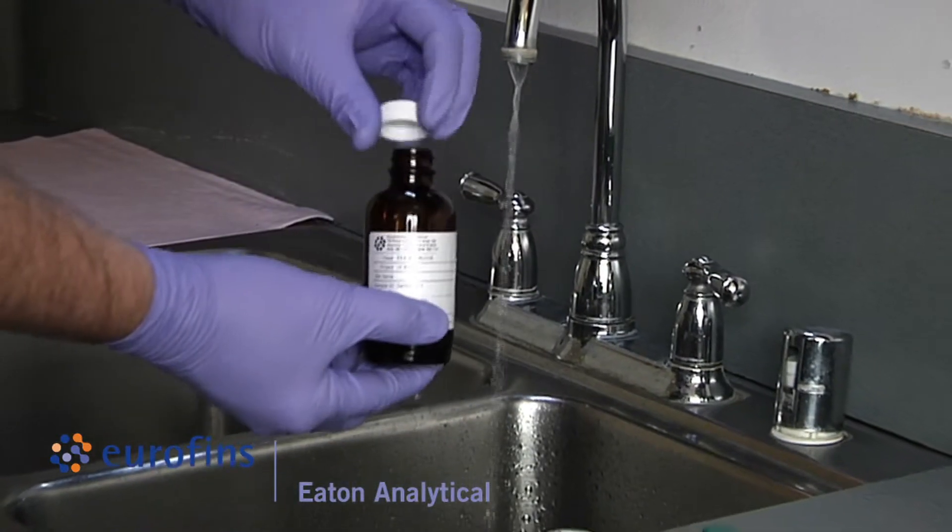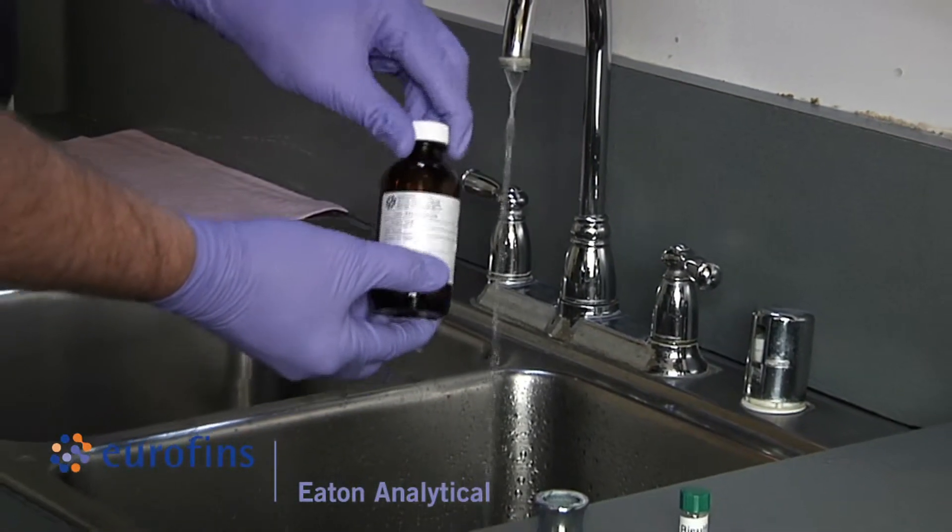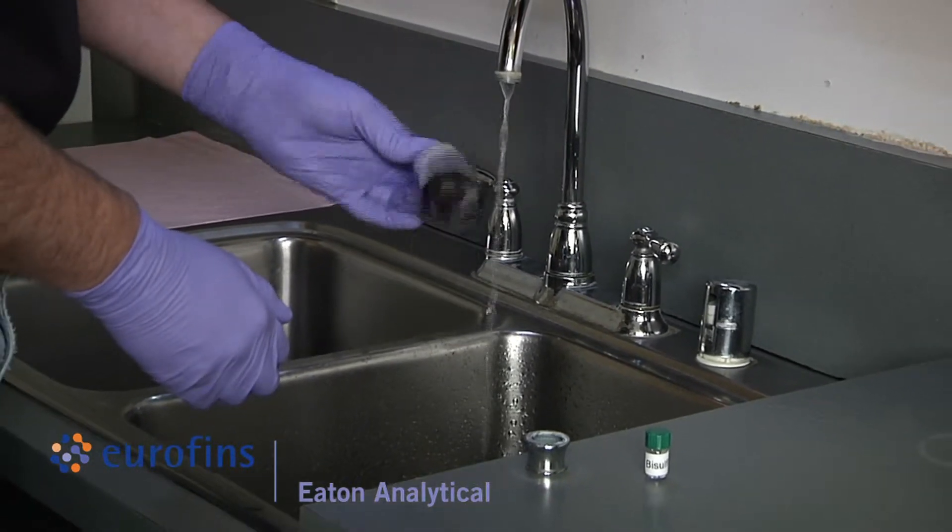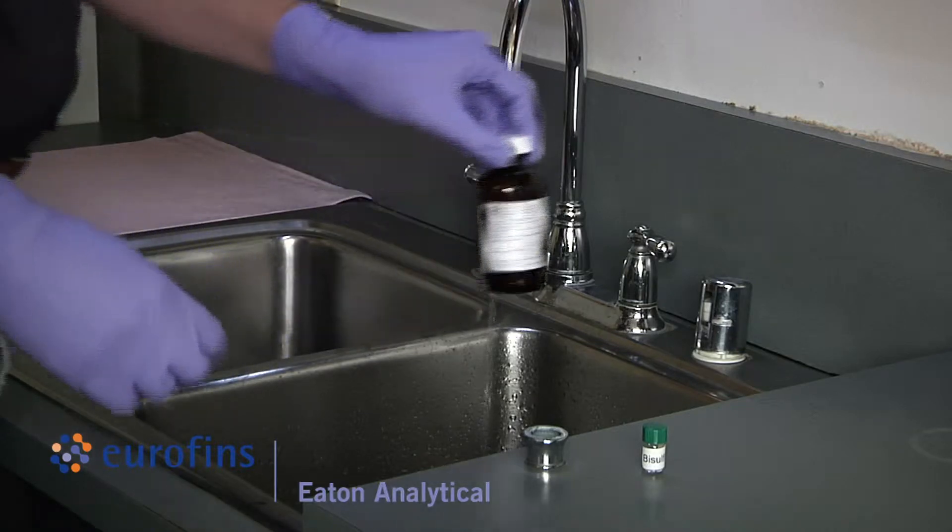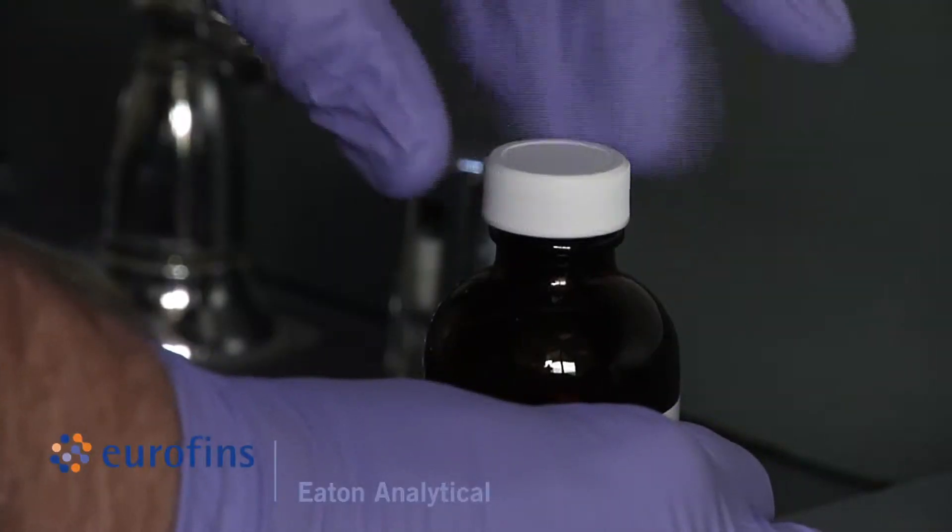Cap and invert the bottle at least five times or until the sodium sulfite is dissolved. Next, open the bottle.